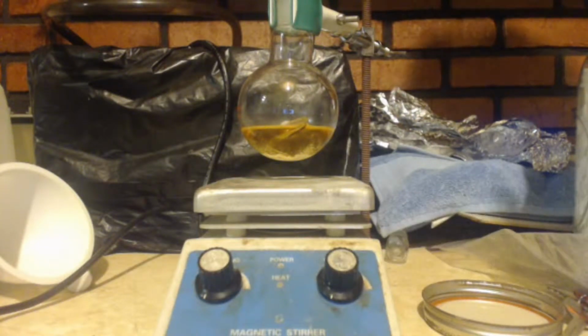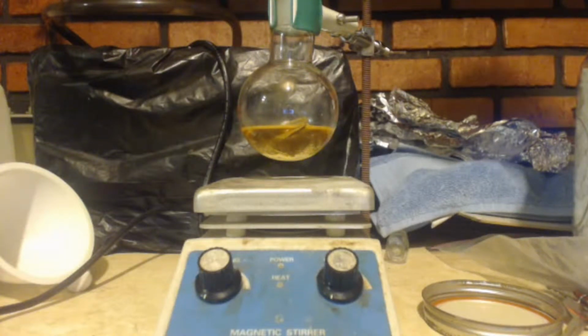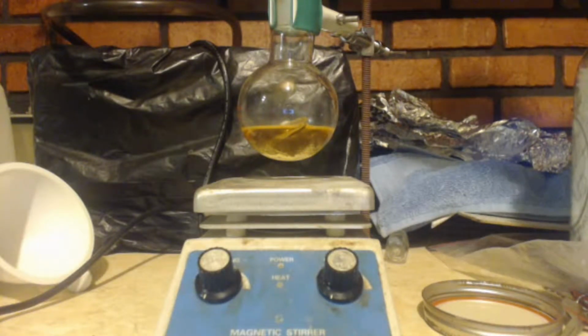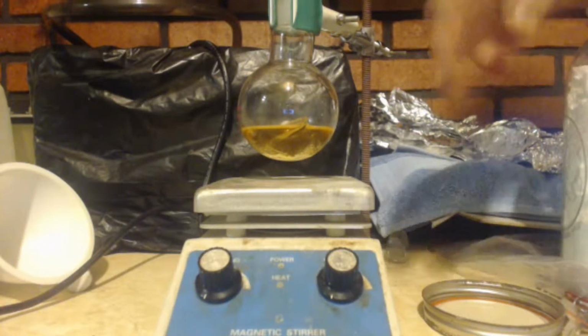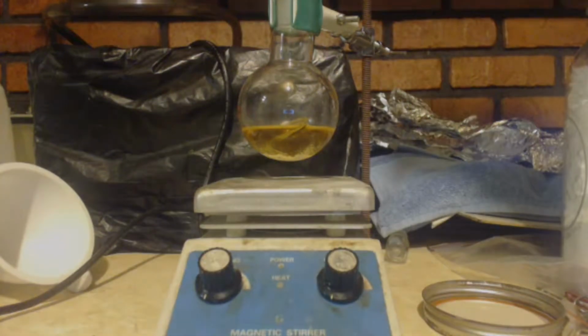But here we're making alcohol. We're trying to make tert-pentyl, right? So we don't want to use calcium chloride, even though it has a lot of carbons. It probably doesn't form a complex, but maybe it does just a little bit. And even if it does a little bit, we don't want that. So I'll use magnesium sulfate for this. And I'll let that stir a little bit, maybe let it sit for an hour or whatever.